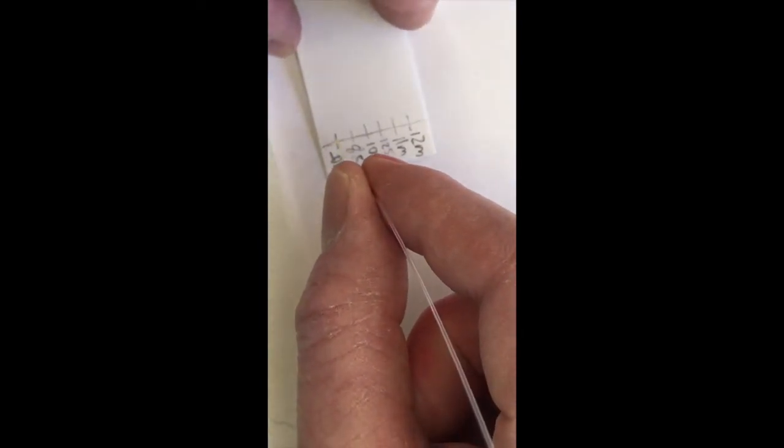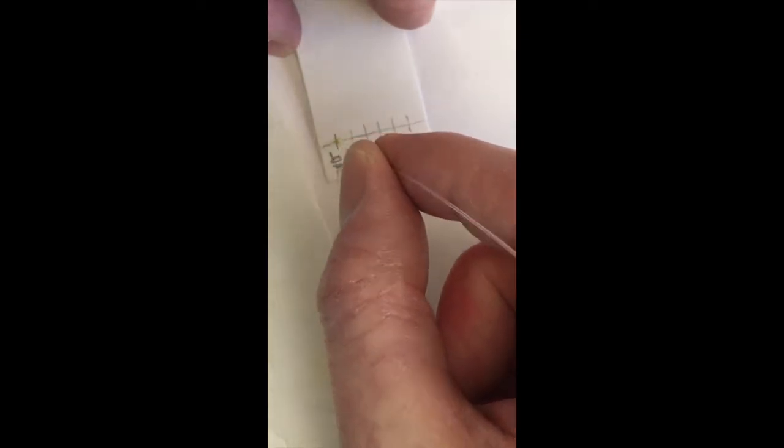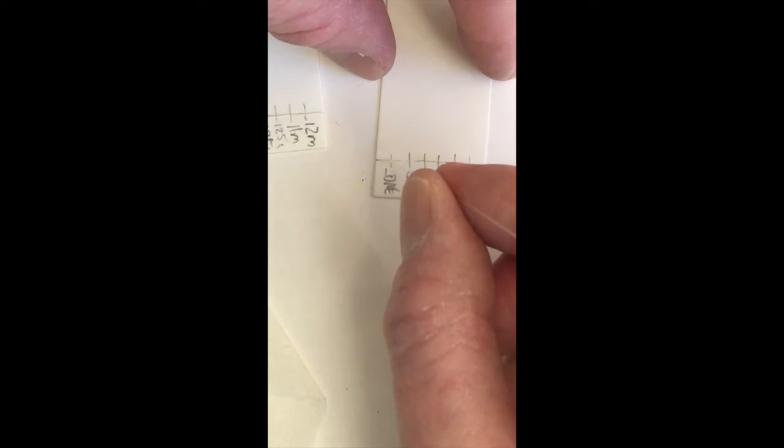So I'm going to be spotting on the very first spot. That's the spot that will be for the fluorenone dissolved in methylene chloride. I'm going to do that for both TLC plates. That's going to be a standard for both. Did that go blurry on you guys? Okay, here it is now, fluorenone. Got it? Okay, those two are spotted.